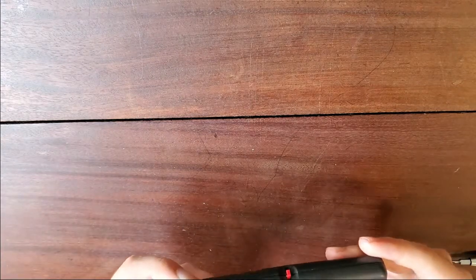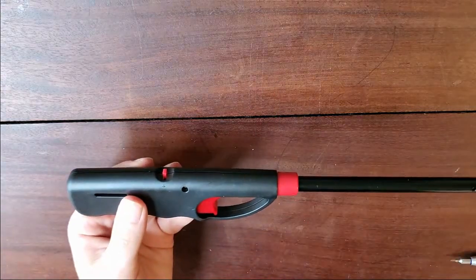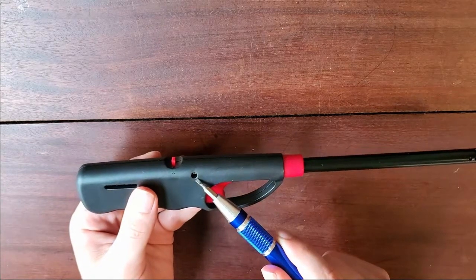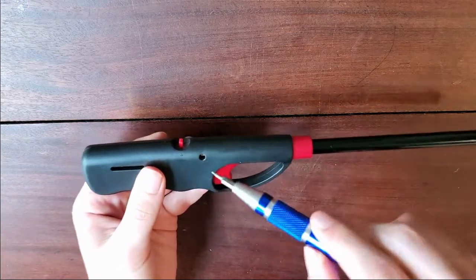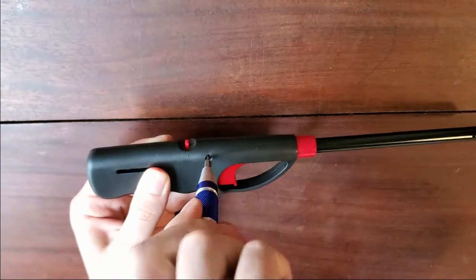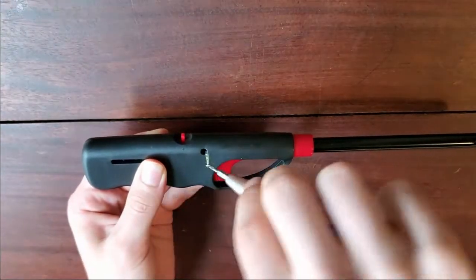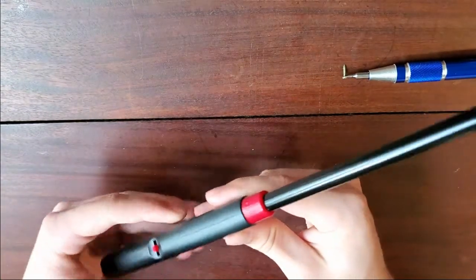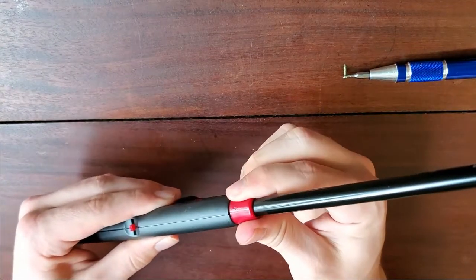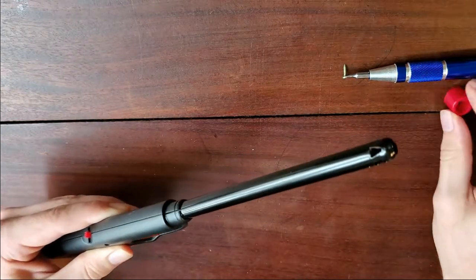But we're not using it as a lighter. Steps to take it apart: there's one screw right here, you can just use a screwdriver and take that out. Next, you'll want to actually remove this red piece — it just slides right off.